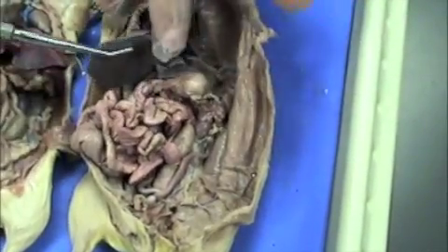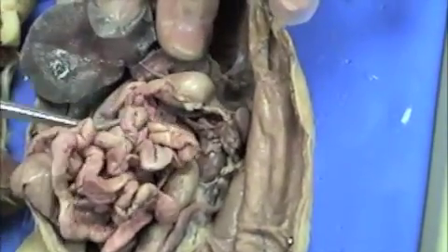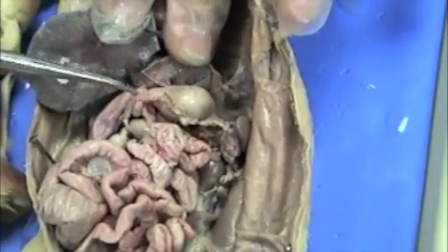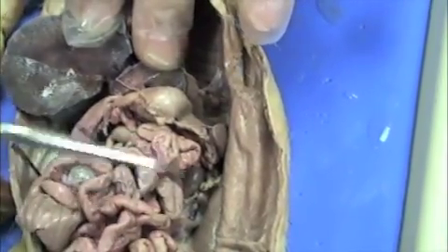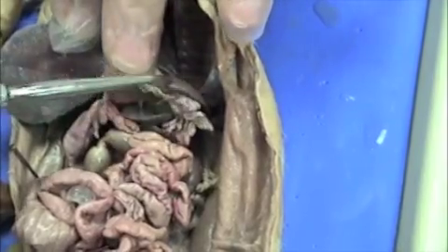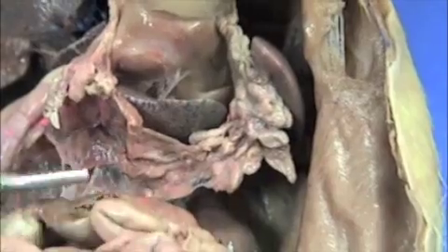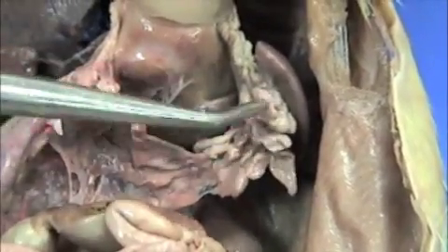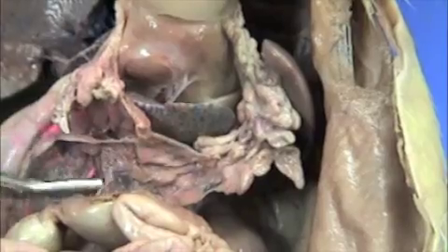This large structure here is the liver, and there are several lobes of the liver. If we lift up the liver, you see the stomach. If you follow where the food goes from the stomach into the small intestine, this tube right here would be the small intestine. This rat has a really good pancreas — you can see this is the spleen over here to the side, and this structure here is the pancreas. It goes all the way from the spleen all the way over here to the small intestine. So this is all of the pancreas here — it's a really good picture of it in this rat.